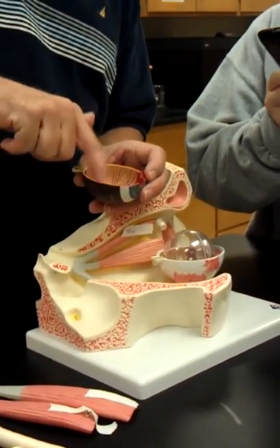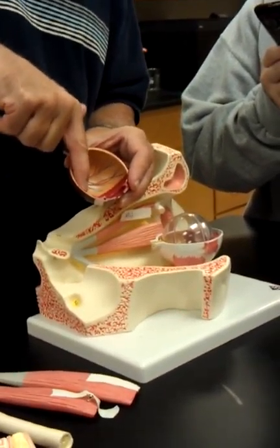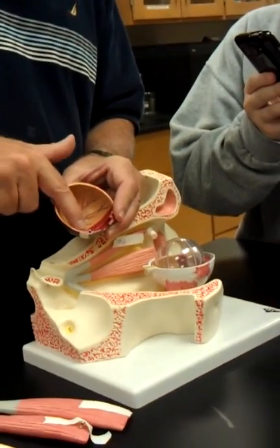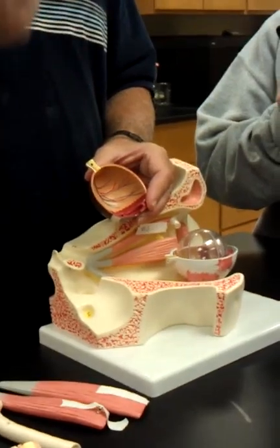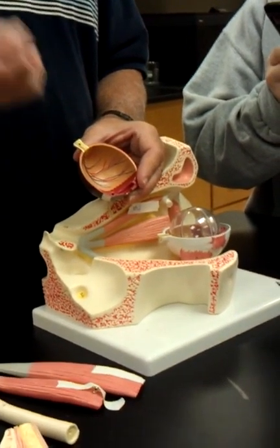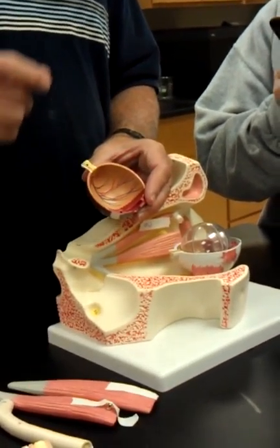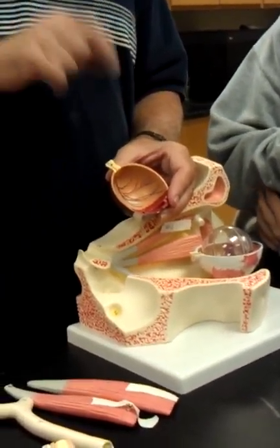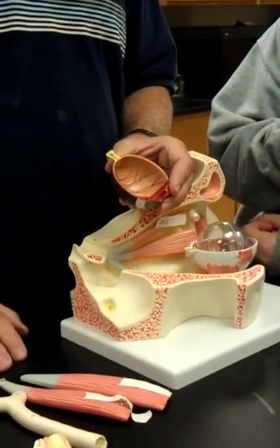Okay, so the orange would be the retina, and the retina meets the ciliary body at a scallop border called the ora serrata. And within the ciliary body, the silver streaks would be the ciliary processes of the ciliary body. The retina is the inner layer. And the retina is made up of 3 layers of cells, and the lowermost layer will be the photoreceptor cells, the rods and the cones, named rods and cones because of the way they're shaped.